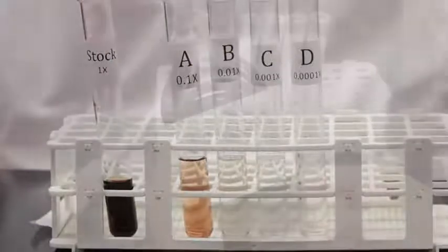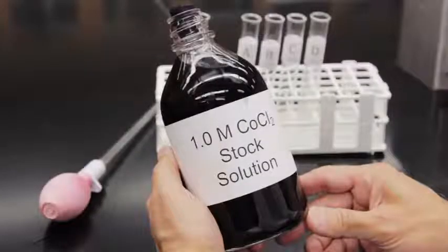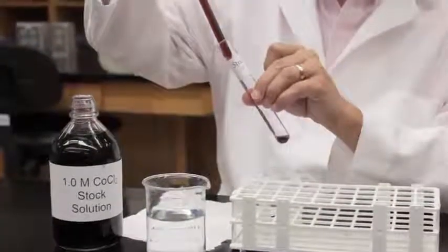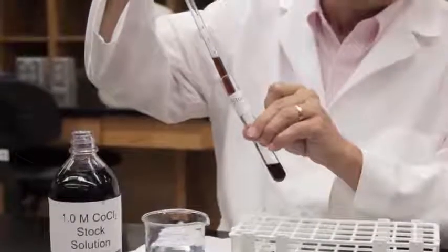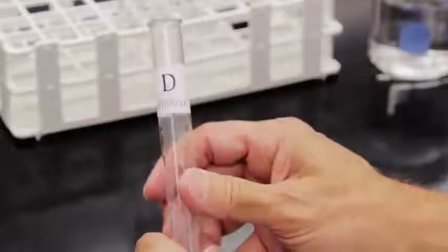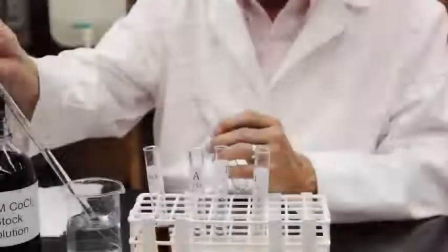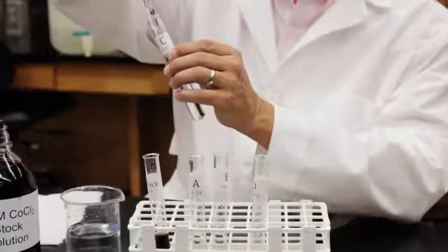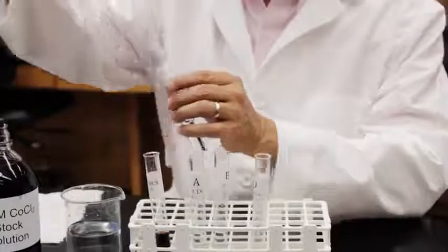We'll use the 1 molar stock solution of cobalt chloride that we produced in a previous video on preparing 1 molar solutions. First, pipette 10 milliliters of stock cobalt chloride solution into a test tube labeled stock 1X. Label 4 other test tubes as tube A 0.1x, tube B 0.01x, tube C 0.001x, and tube D 0.0001x. Use a clean pipette to add 9 milliliters of distilled water to each of these tubes. This water is the solvent to progressively dilute the stock solution.